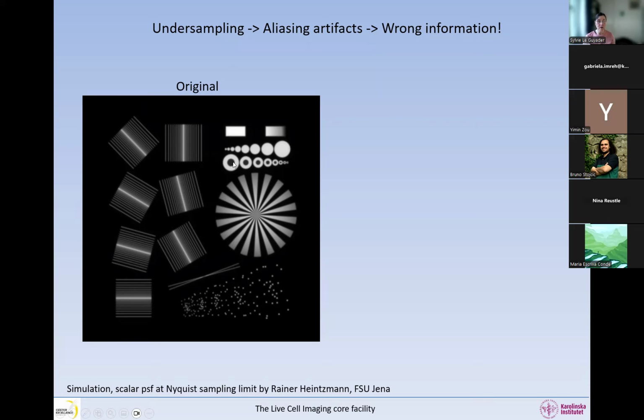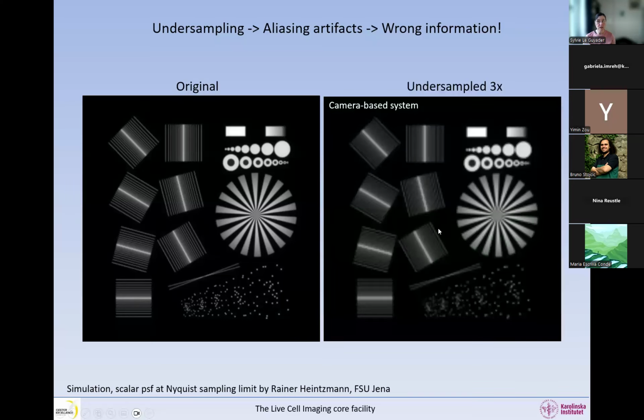Here we have round objects with a little hole in the middle, and in here we have all sorts of things. And here we have a little bit more something that would look like our samples. Now we're imaging and we're undersampling this image, and what you can see is lots of moire artifacts in these regular patterns.